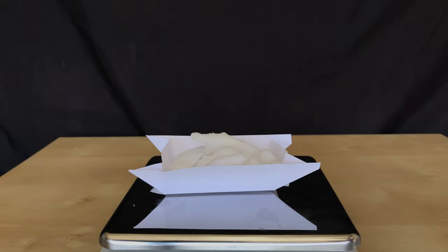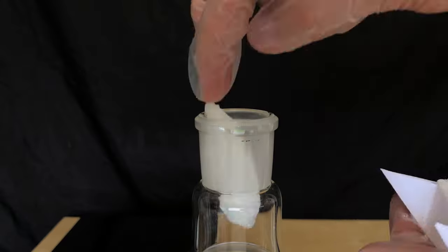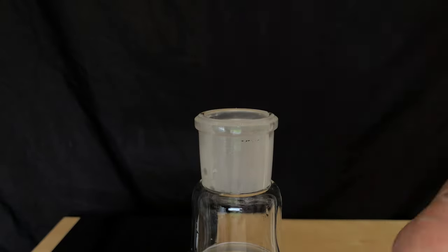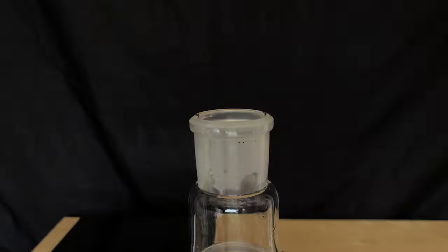Camphor is this white solid with a very pleasant smell. We weighed out about 38.1g. It would have been better to add the methanol to the camphor to avoid splashing, but I did it the other way around.